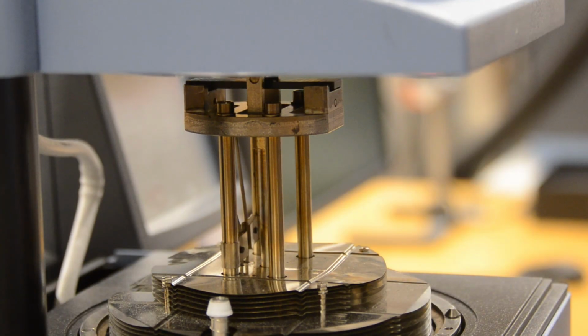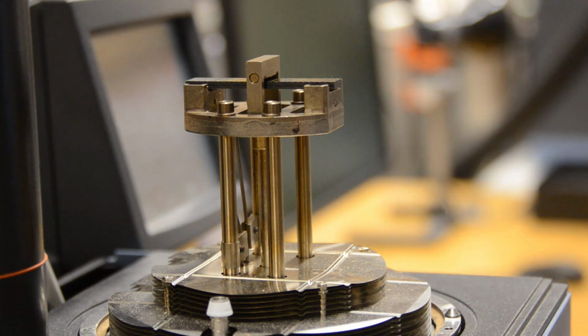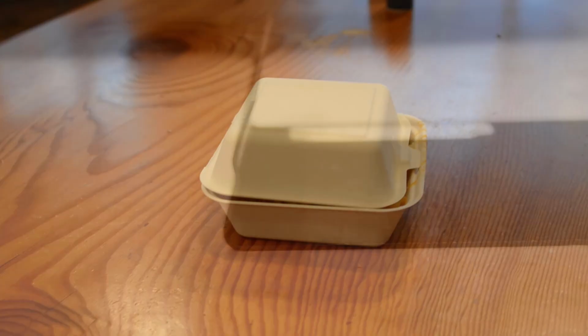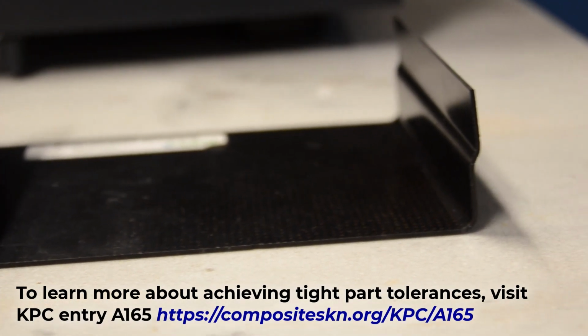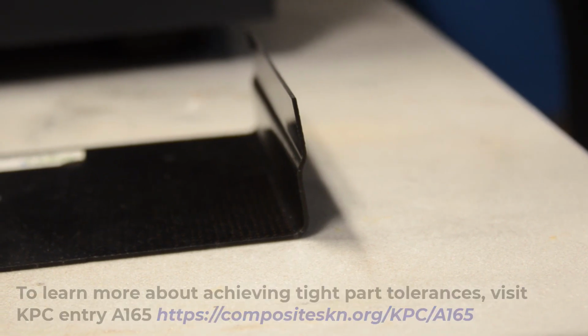In addition to determining the Tg of polymers, DMAs can also be used to obtain other information as well. The stiffness of polymers versus temperature can be used to design manufacturing processes like thermoforming. The elastic properties of thermosetting resins as a function of degree of cure can be used to simulate and manage the effects of shrinkage and thermal expansion during composite part manufacturing, leading to tighter tolerance parts.